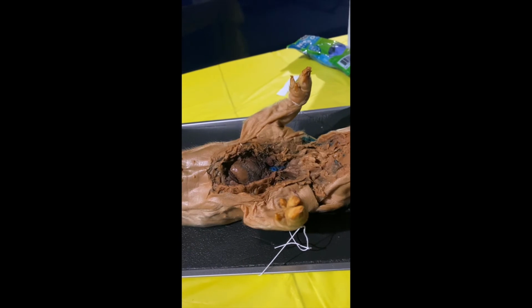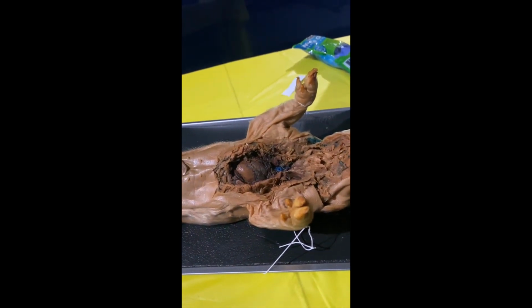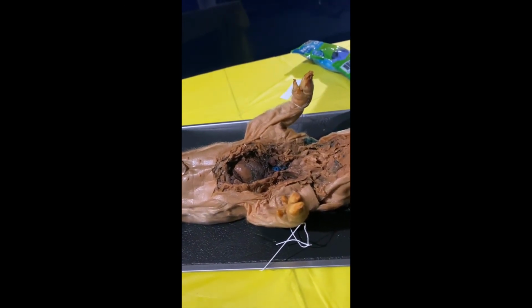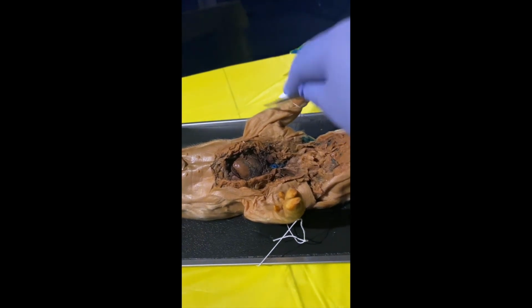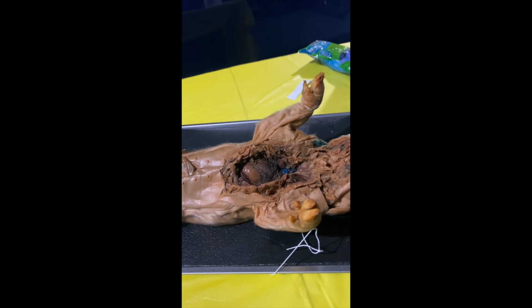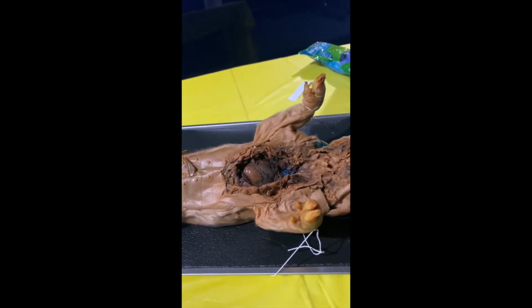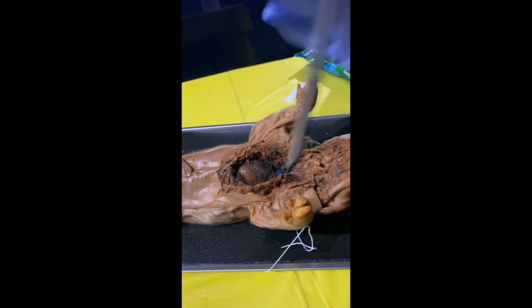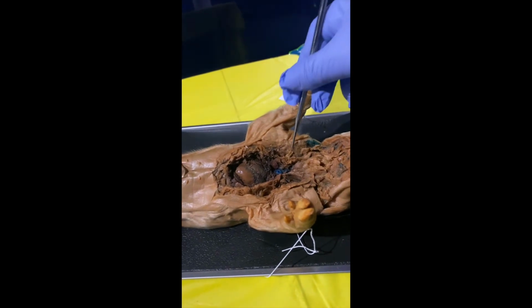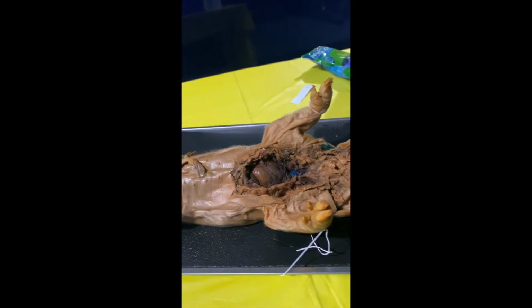Next up is the cephalic vein. So the cephalic vein is a superficial, so very close to the top, vein of the upper limb. So in this pig, upper limbs are these two. And they carry deoxygenated blood from the capillaries back to the heart. And in anatomy, as far as body positioning, cephalic means head. And the cephalic vein should be right around in this area.